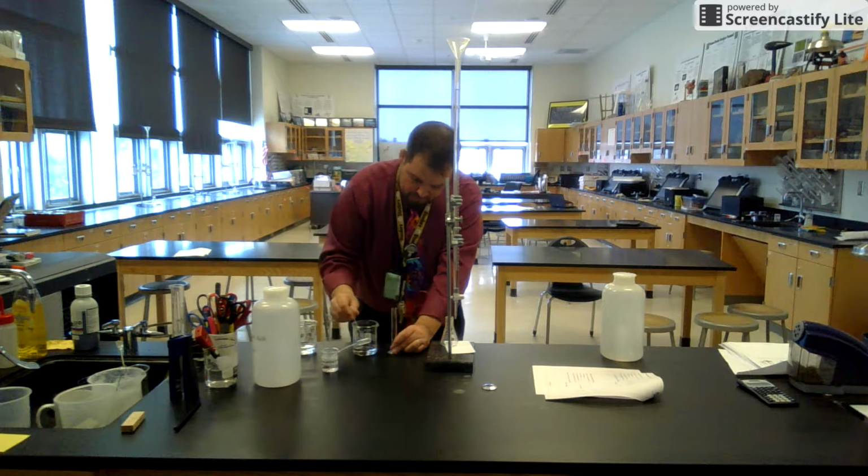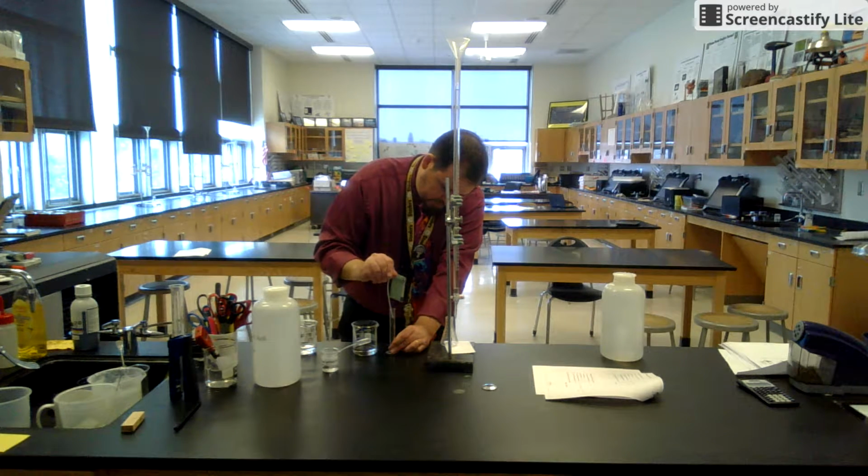So I'm actually going to see if this takes too long, Matt.